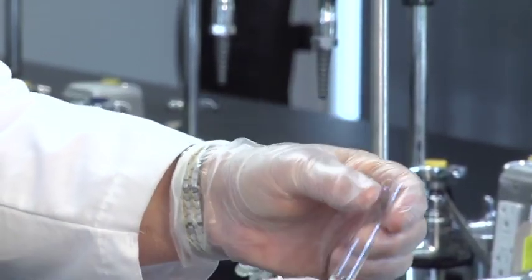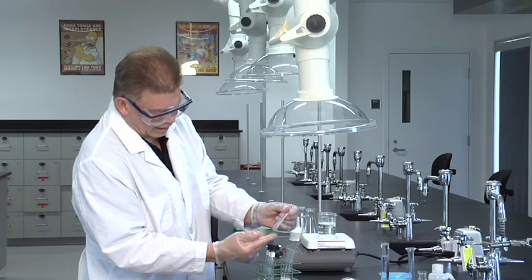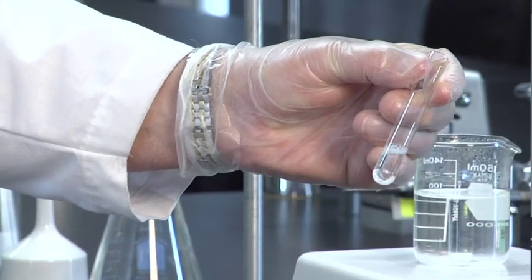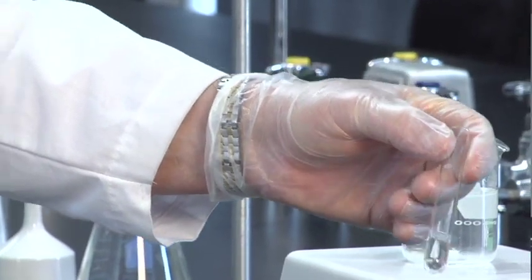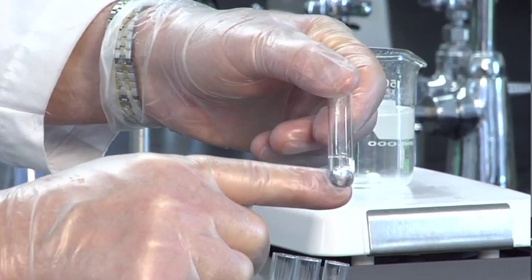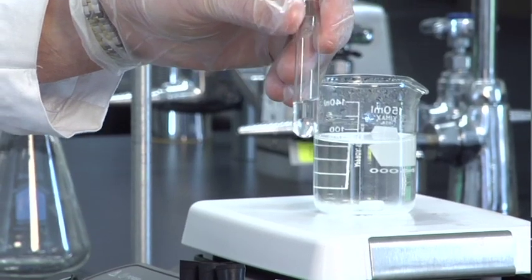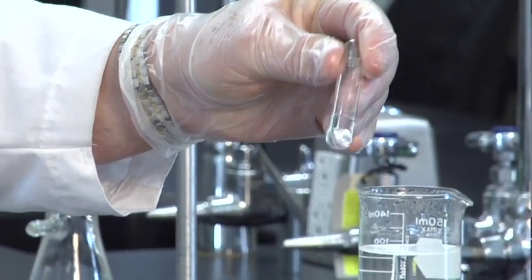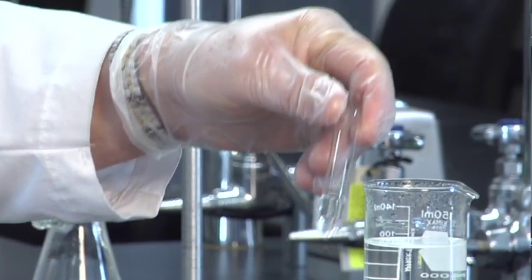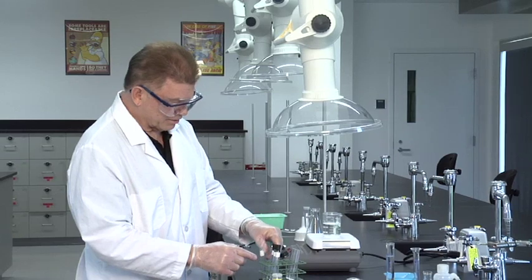I'm going to mix this tube by smacking it with my finger. There's no white solid in the bottom of the tube — the solution is completely homogeneous. Like dissolved like. Not good for a recrystallization solvent because we need it to be insoluble cold. So methanol failed the test.